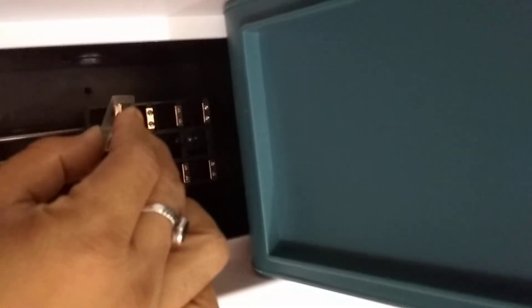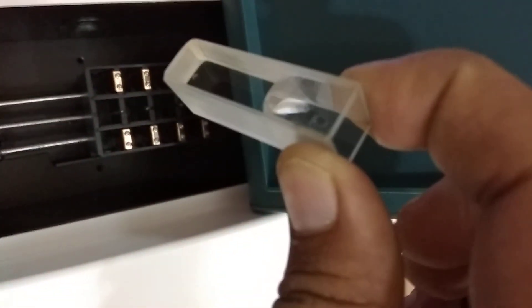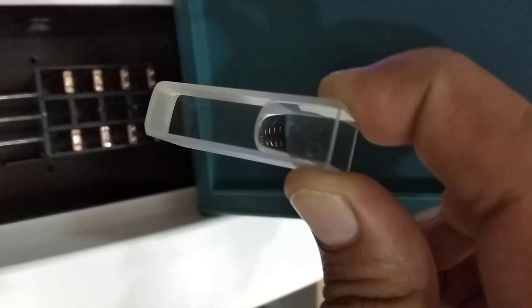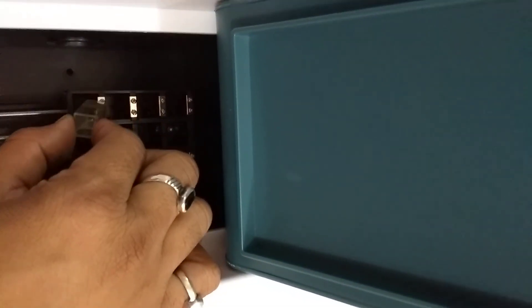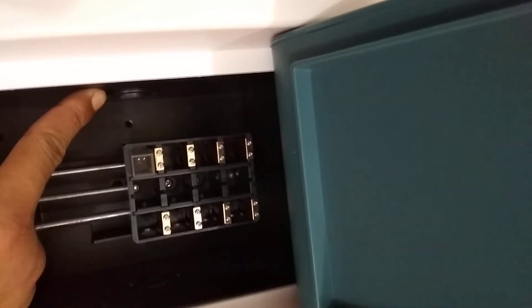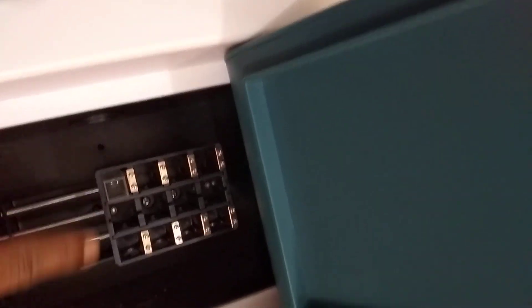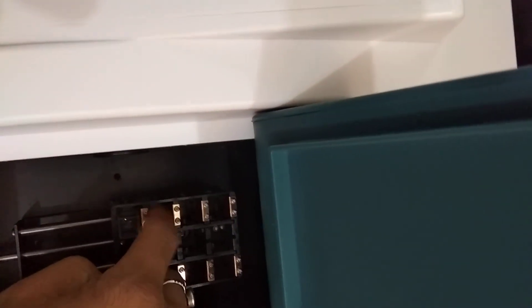This is your sample compartment with a 4-cell auto changer. In cell number one, place your reference solution. Always hold the cuvette from the rough side — never from the transparent side — and insert it so that light passes from the light source through to the detector.